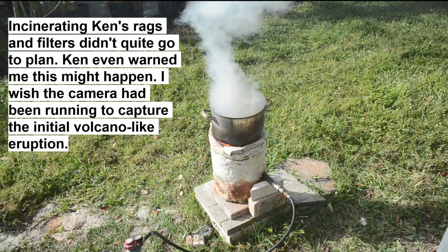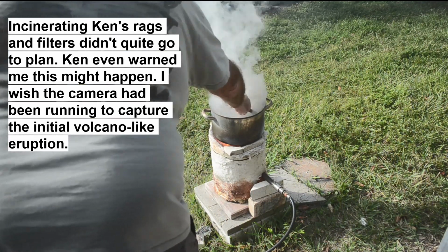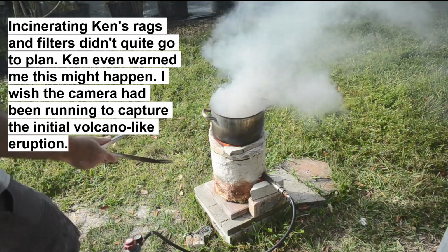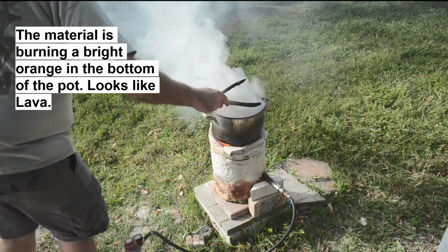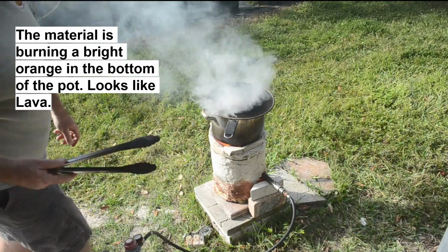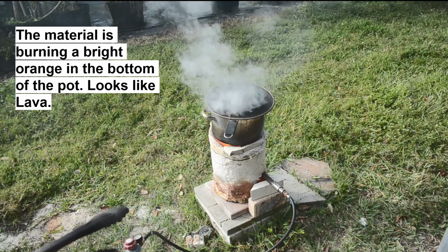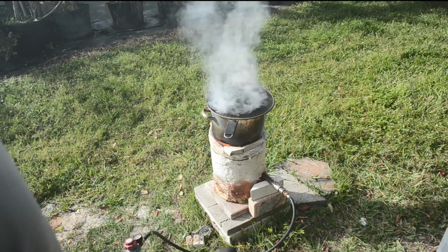Okay, I just put a bag of really dry stuff in there, and we got kind of a, whoa, really crazy reaction. Yeah, that stuff's cooking off like crazy. That's the stuff that's soaked with potassium nitrate, I guess. That dry stuff went in there and immediately just started flaring up. I was afraid something like that would happen. I missed the first part of it. I didn't get the camera started soon enough.